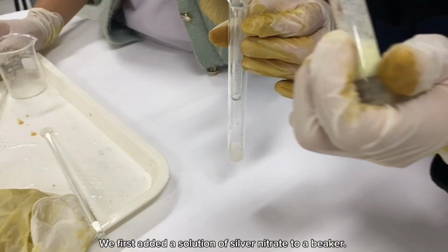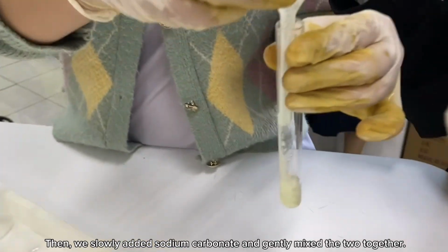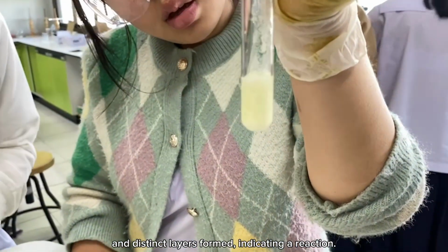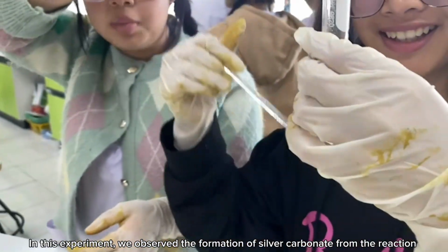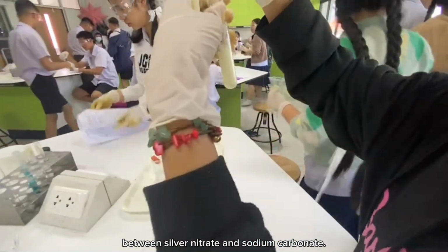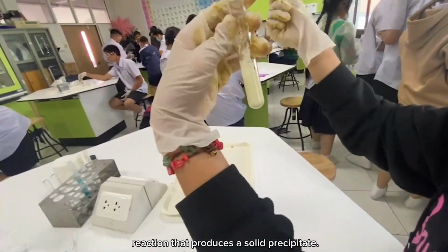We first added a solution of silver nitrate to a beaker. Then we slowly added sodium carbonate and gently mixed the two together. As the chemicals combined, the solution turned yellow and distinct layers formed, indicating a reaction. In this experiment, we observed the formation of silver carbonate from the reaction between silver nitrate and sodium carbonate. This reaction is an example of a double displacement reaction that produces a solid precipitate.